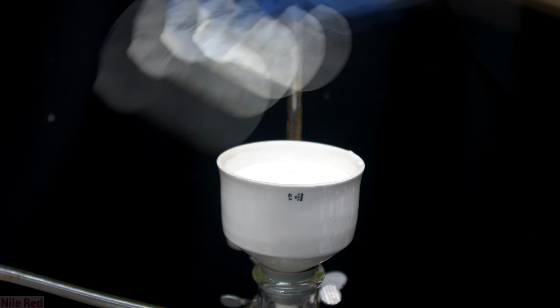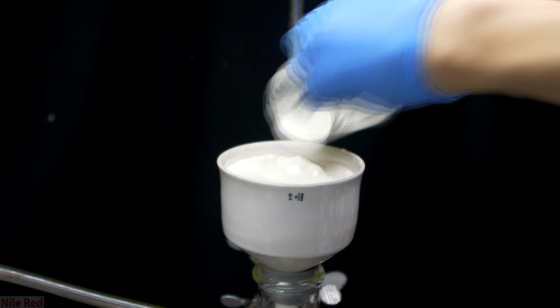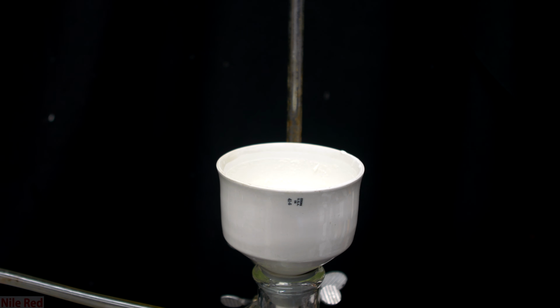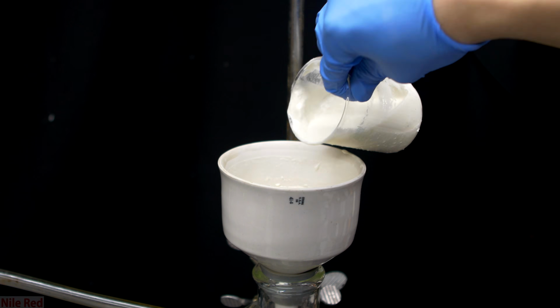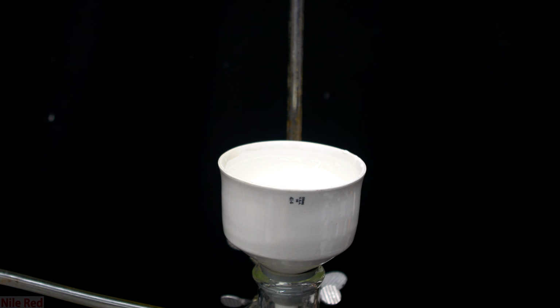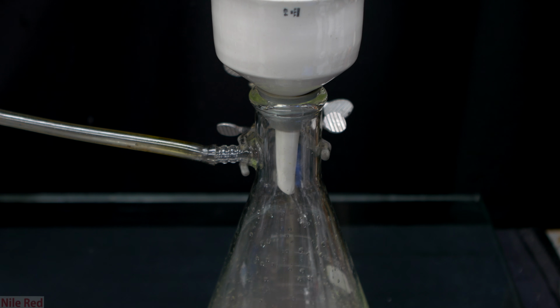So after realizing that this method was a total failure, I ended up having to vacuum filter it anyway. To do this, I just used a small beaker to scoop out the mercury thiocyanate and pour it into my Buchner funnel. This turned out to be the way better method, and I really regret even trying to evaporate it at all. All of the water that's filtered through is going to be contaminated with mercury, and this too has to go to a mercury waste container.